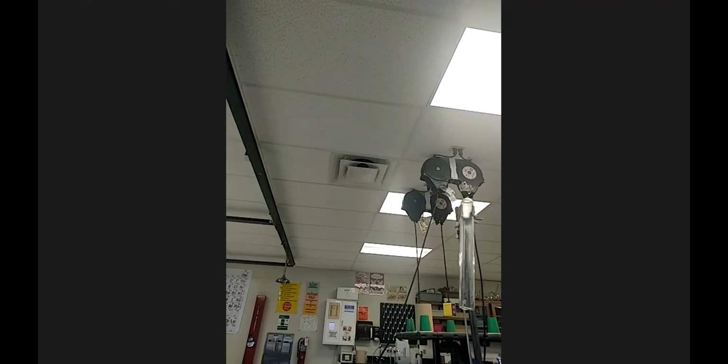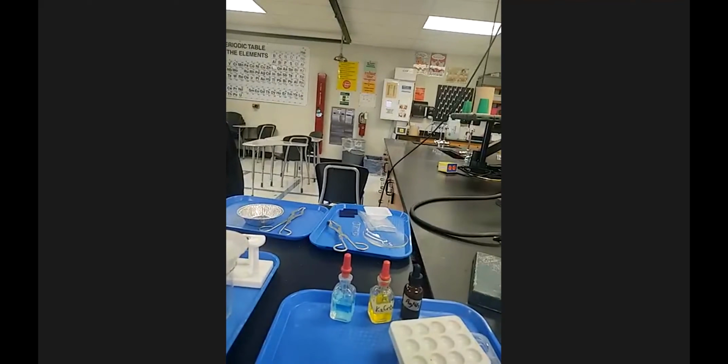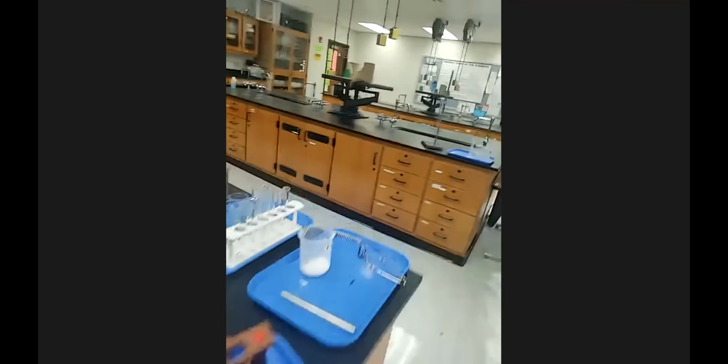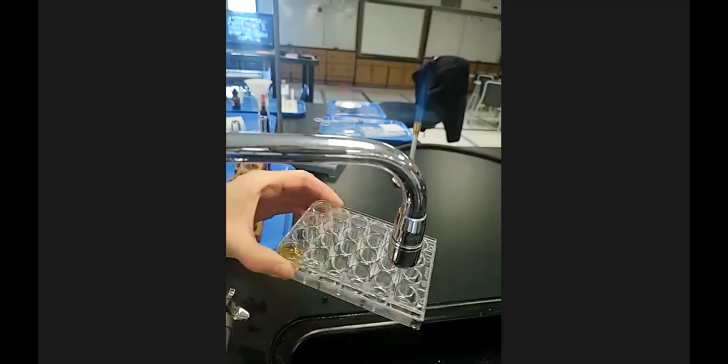So that's 5. Now for this one, for well plates, for cleaning these, again, you don't want a large stream of water. You don't want whatever this is to splash, with tap. So fill them up and then dump, and multiple times.